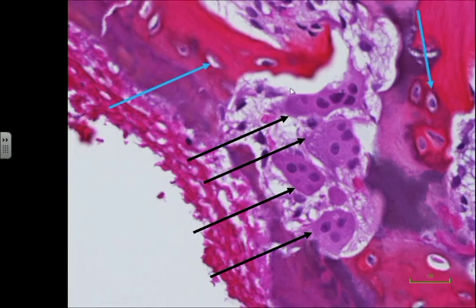So this is an area of bone. I'm highlighting over here the bone, and then there are several osteoclasts. 1, 2, 3, 4. These osteoclasts, as I mentioned, are much bigger cells compared to the osteocyte size that is highlighted by the blue arrow. The osteoclasts are much bigger, and they contain several nuclei. This one contains 1, 2, 3, 4, 5, 6 nuclei, and maybe actually 7. This is the rest of it. So, big cell with many nuclei.